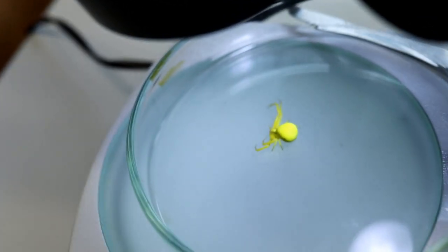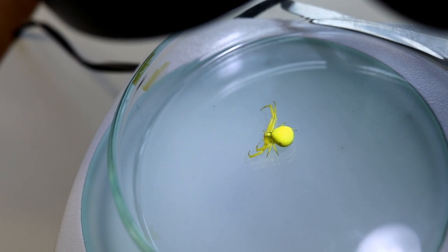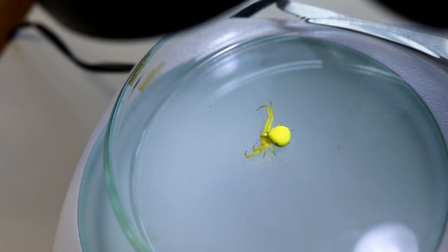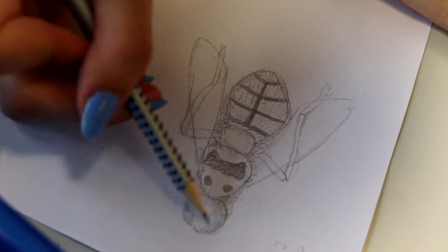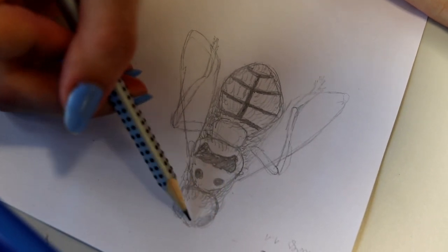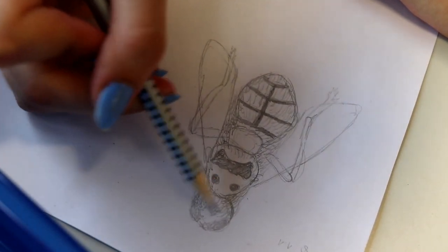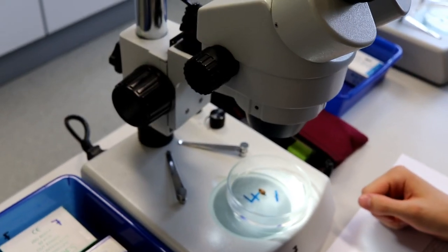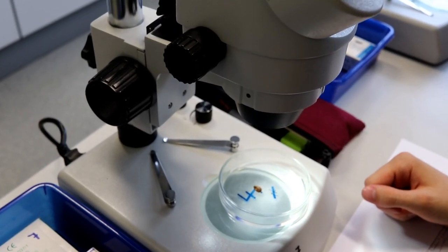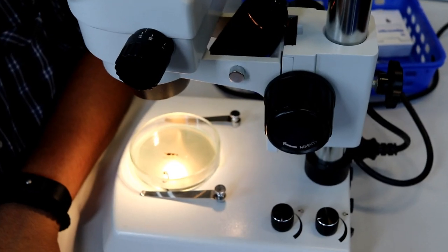This is not an insect — this is a spider again. If students start to lose their fear of insects and spiders, then I think the project was already worth it. Some of the drawings that students make are really artistic. We do not grade the artistic quality of a drawing, but we feel it's important that students learn how to observe this way, and the results we get every time are really remarkable.